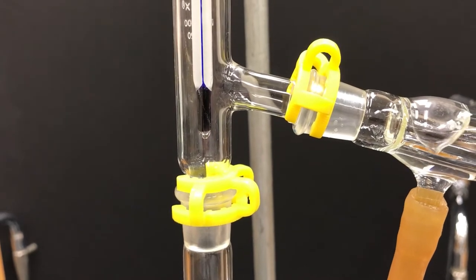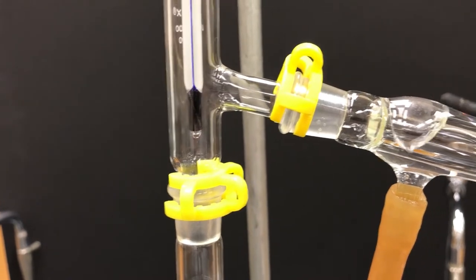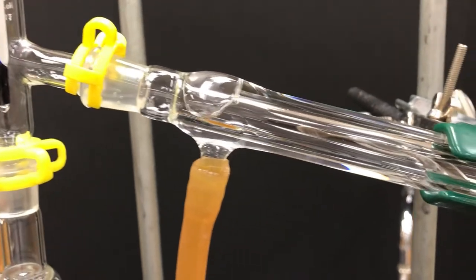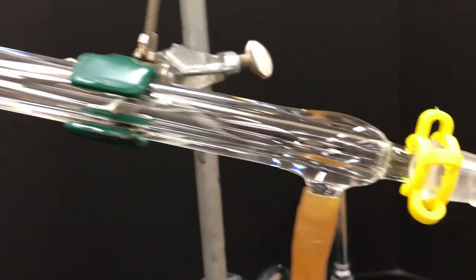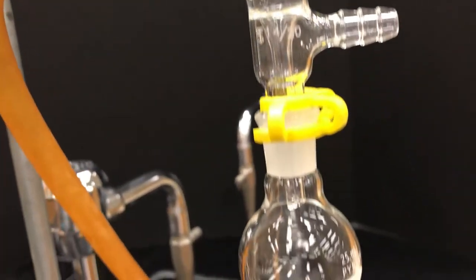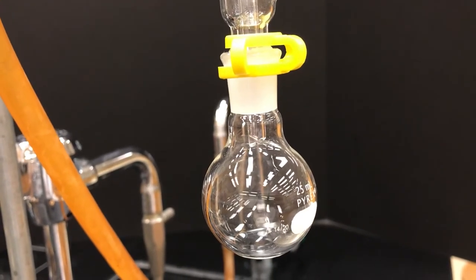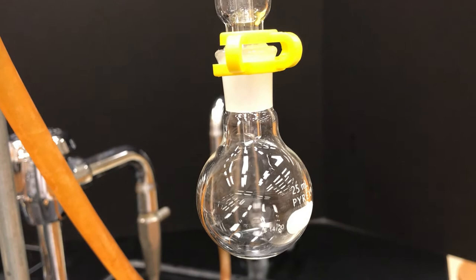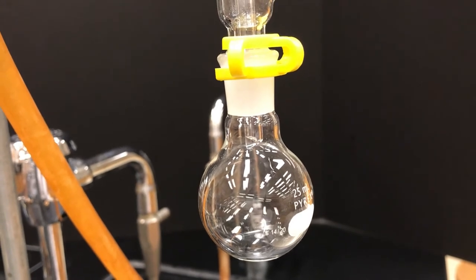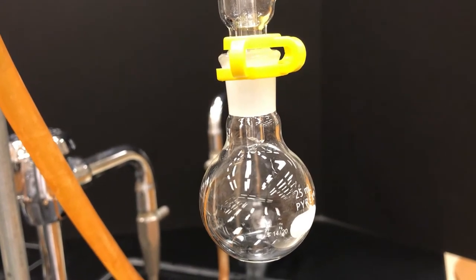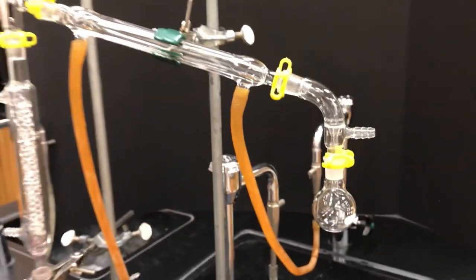So it is working even though it's not super obvious, and you can tell that it's working because if you look off to the side and go into your receiving flask you see drips. So it is working and it's slowly distilling, drop every couple seconds or so, and that's the whole process. Looks good.